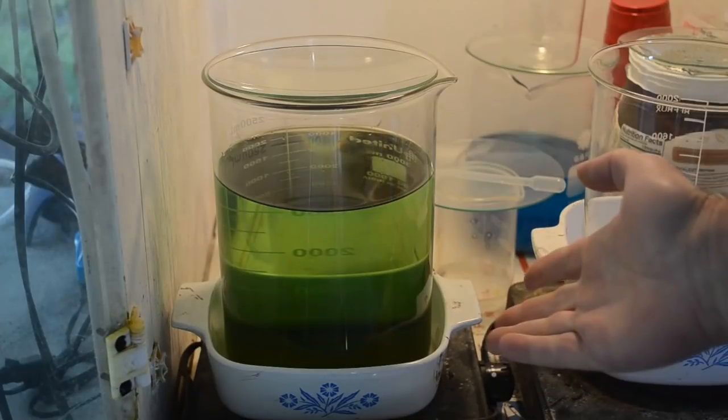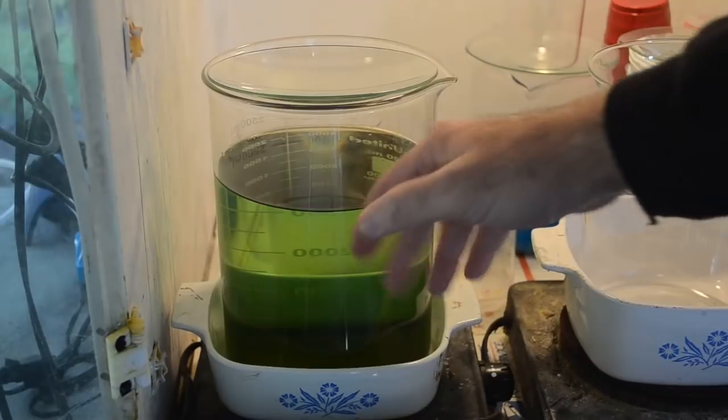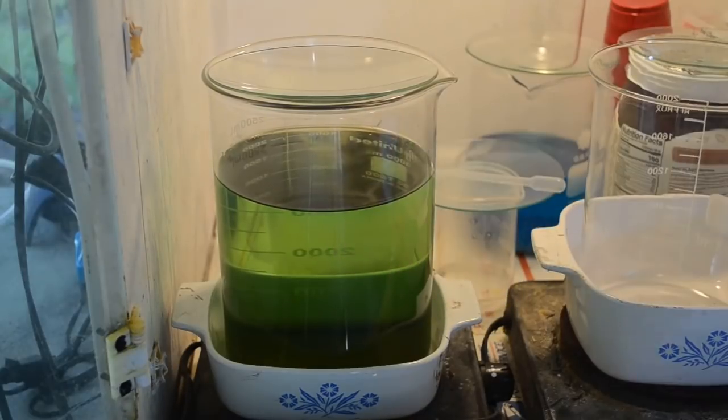This doesn't seem to have any silver chloride, but it's coming out of this lime green nastiness, so I need to refine it anyway.